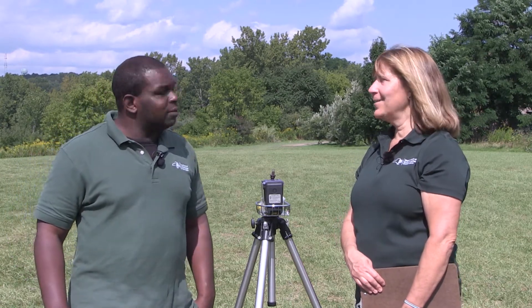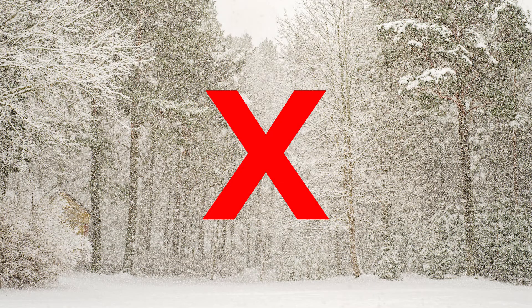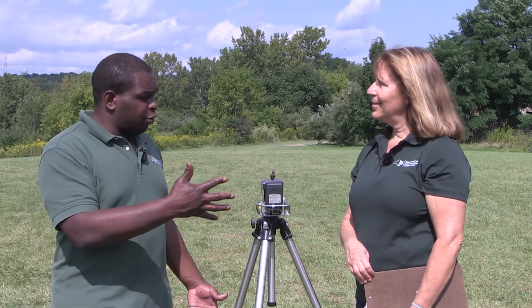What about the weather? What kind of day do we want before we use this? Weather's really important. You want to pick a sunny day where it's not raining or snowing. Clouds are okay too, but you don't want any precipitation. And a light breeze helps because that'll push that air towards the equipment. A light breeze is perfect, like today.